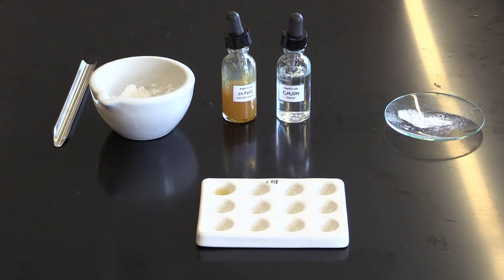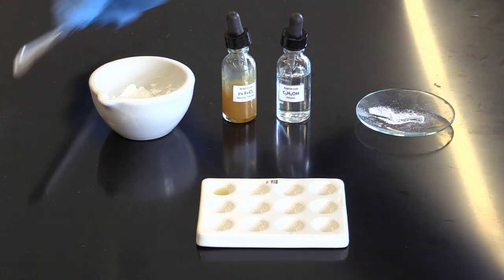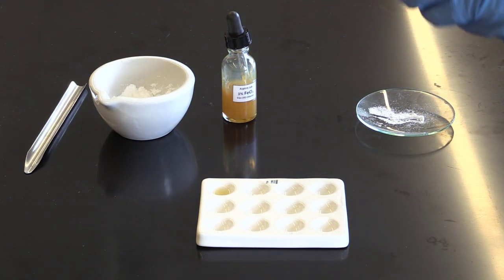So then in our next well, we will take some aspirin and mix it with the ethanol, followed by the iron 3 chloride.